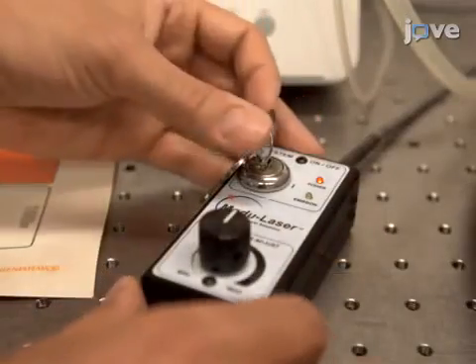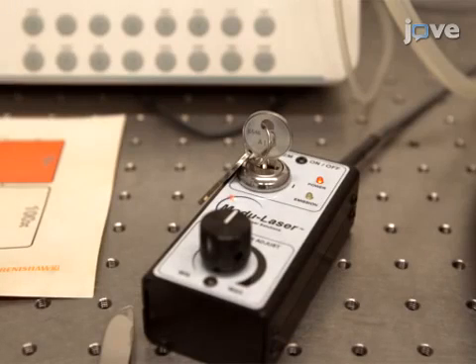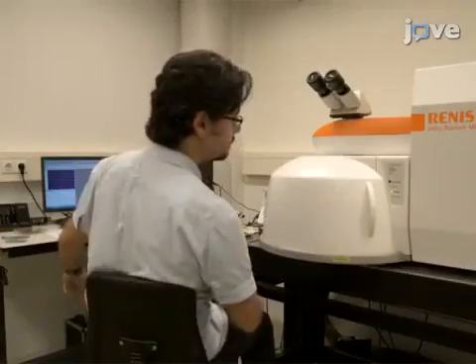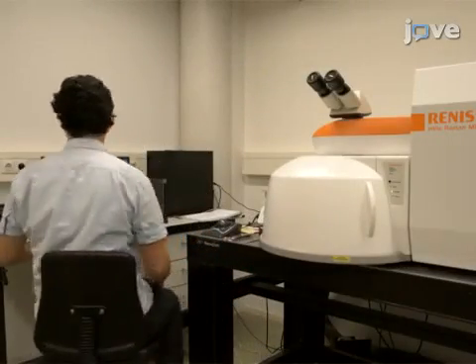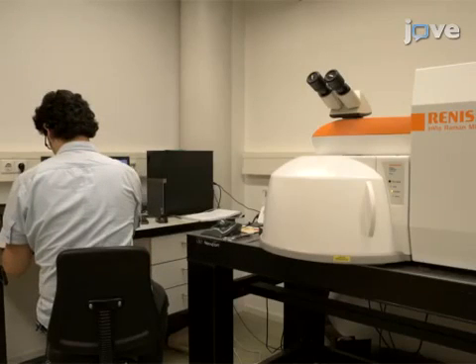Next, turn on the laser of the Raman spectroscopy setup and allow it to warm up for approximately 15 minutes in order for the laser intensity to stabilize. Make sure the laser and active lights are off before opening the door in order to be safe from the unwanted illumination of the operating laser.